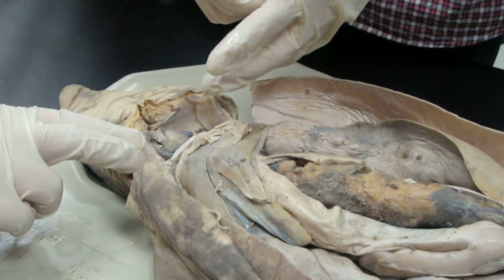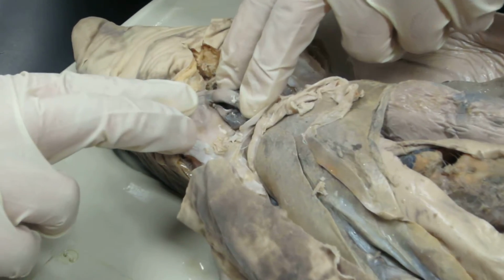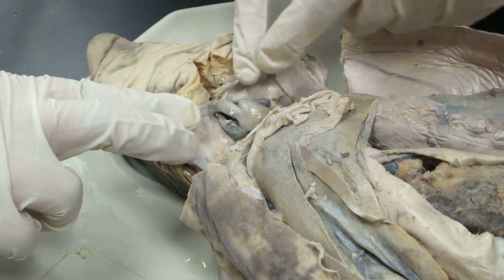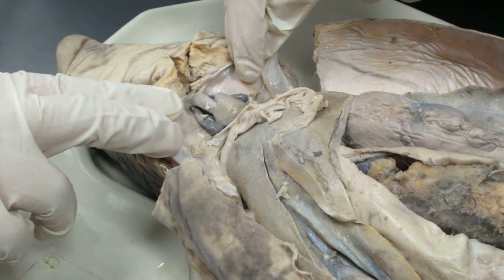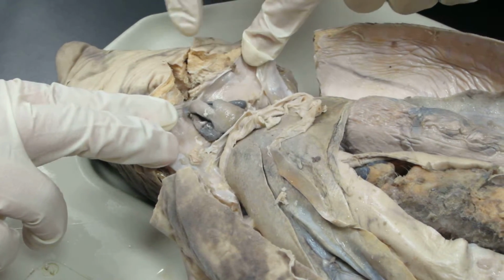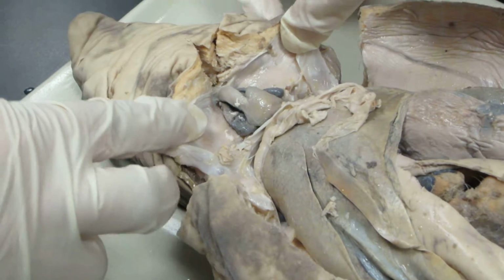Anteriorly as the ventral aorta. Right, so this right here, like I said, is the ventral aorta. That's where, like a human heart, once you pump, all the blood flows through there. What's next? Then they trace the ventral aorta anteriorly and see where the paired aortic arches lead off to the gills. So the gills are on these two sides, right?